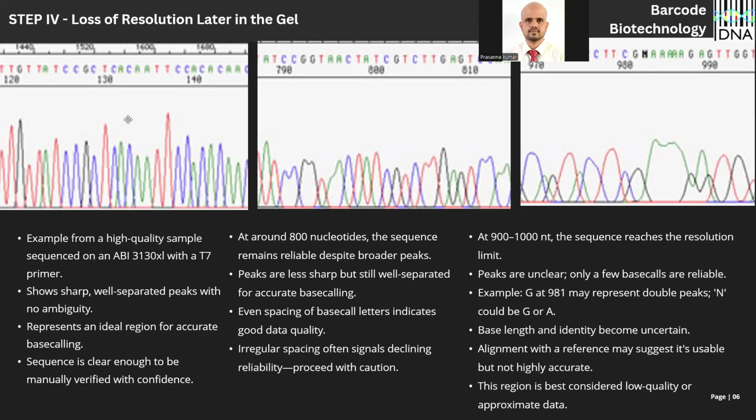In the first chromatogram, I would say this is completely fine. You can consider this region. In the second chromatogram, I would say unless you can call the peak very precisely. For example, in the 792nd position, there are two G's. I can simply see two peaks here. Okay, this is evident, so G is acceptable. But here, I don't see a prominent adenine peak. So calling it as two adenines should be reconsidered.